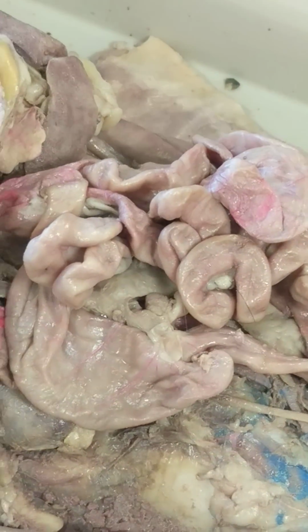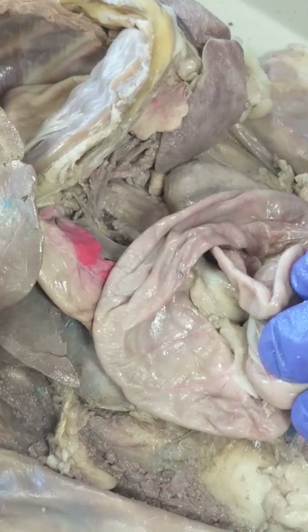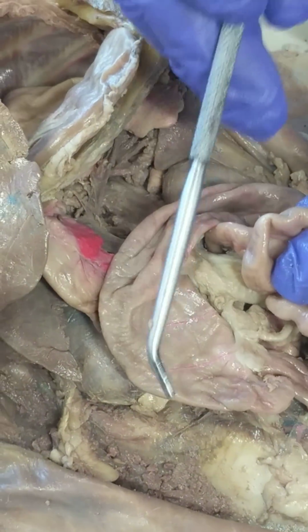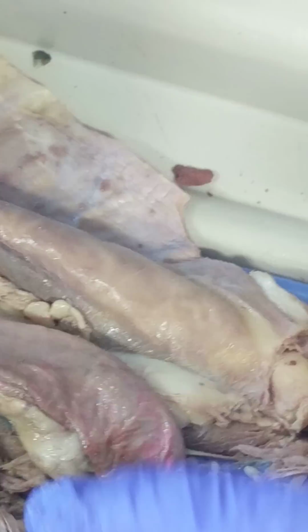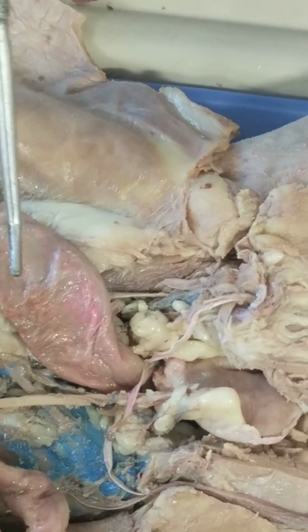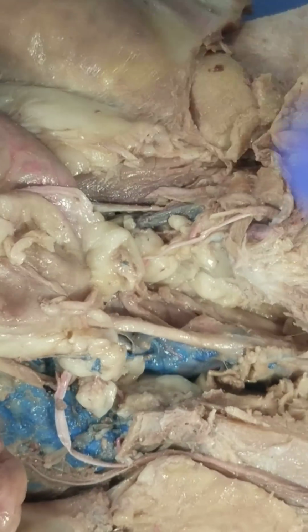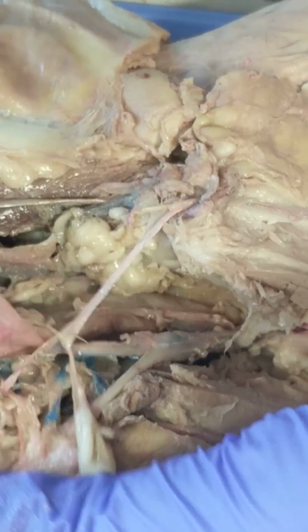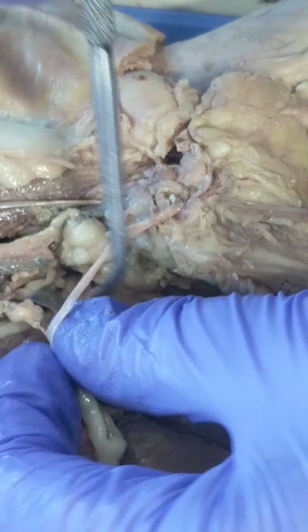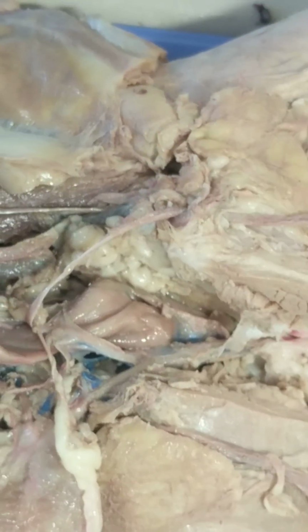So if we are trying to make the cat's large intestine, also known as the colon, mimic the regions we find in humans, this would be equivalent to the ascending colon, transverse colon, and then descending colon. Not much of a sigmoid at all. And then as it dives down deep, I'll show you where my probe goes here. Since you're on that side, here, I'll flip this over. That's the rectum down there. Is that okay? Mm-hmm. Okay.